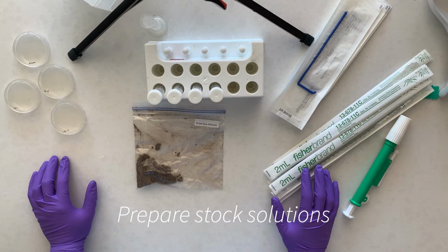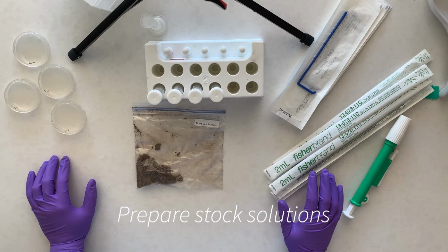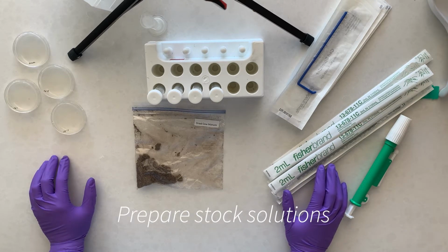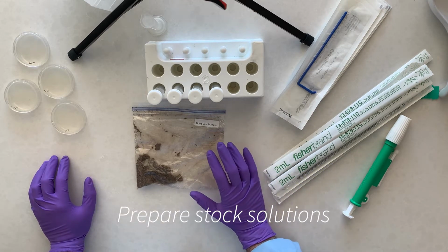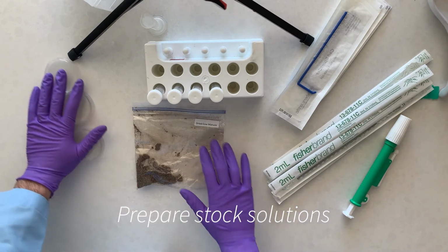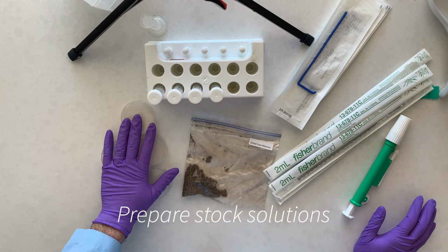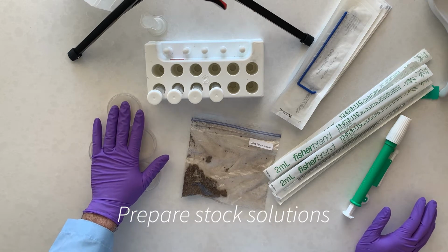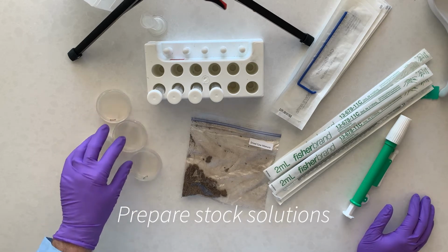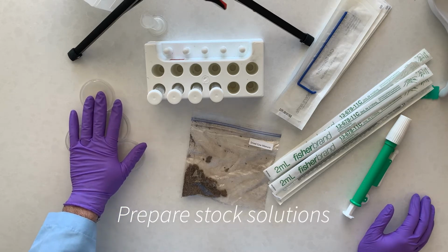Okay, so in this video, we're going to be discussing Laboratory 8, which is selective media. There are going to be several experiments with this, and this is the first of several that we're going to do. What you can see that I have laid out are the things that you need for the first day. I've already poured these nutrient agar plates, and that's been a standard practice. Mine have been in the fridge, and so they've warmed up to room temperature.